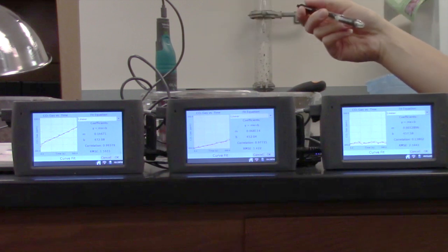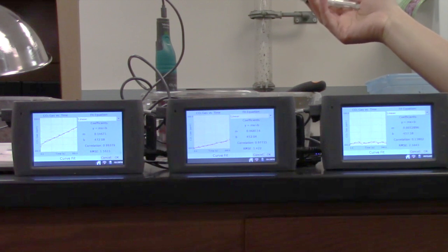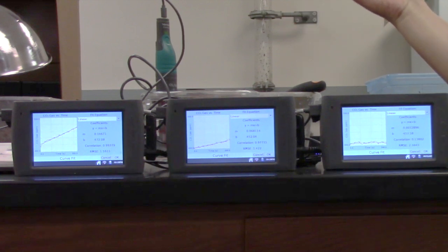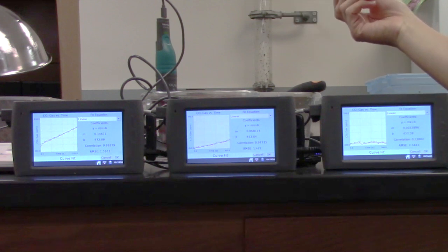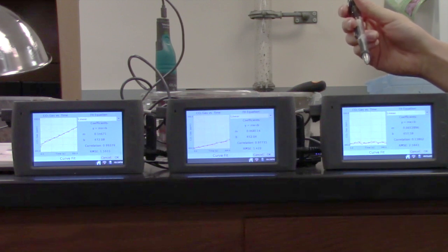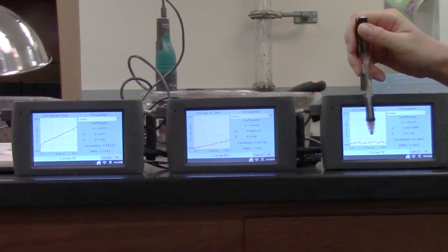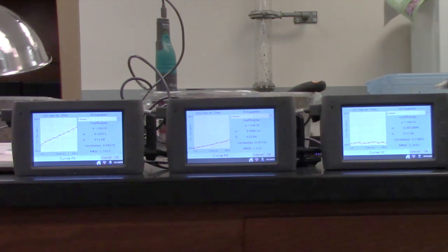All right, so we ran all 3 of our treatments, and we have all of our graphs set up here. After running them, we made sure all the graphs were to scale. This is important so we're comparing the same data and the same information. You can really see what happened with each treatment. For this first one, this was the cool and dry soil. You can see the graph is fairly flat-lined, not a big slope. Our slope actually came out to be 0.003, which is a pretty small value.